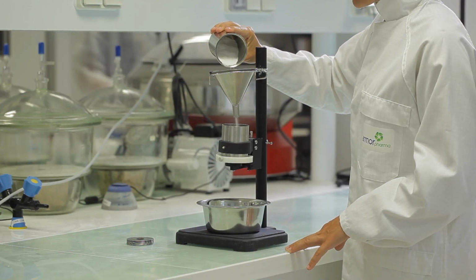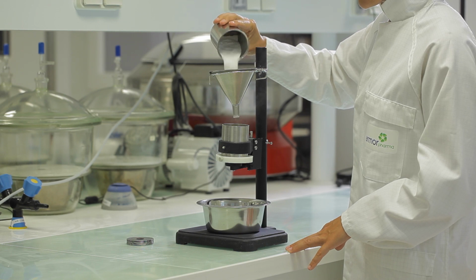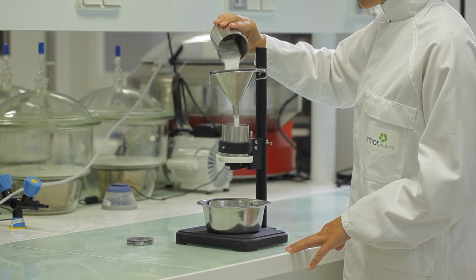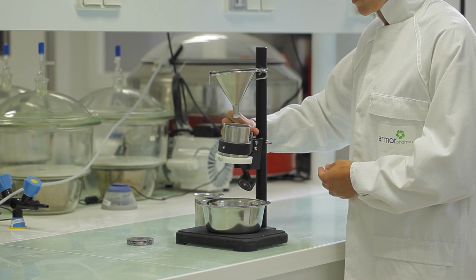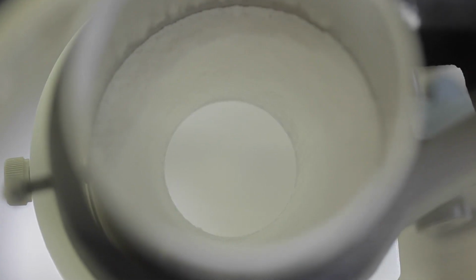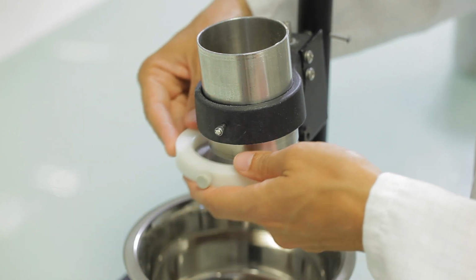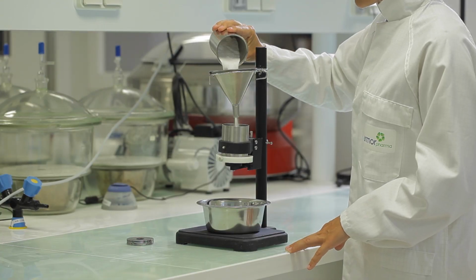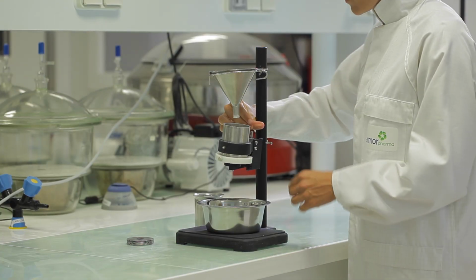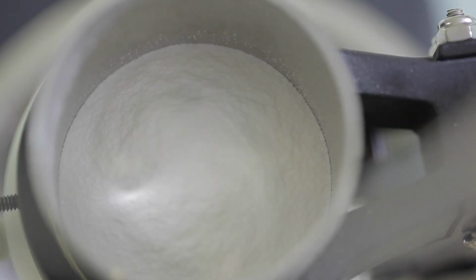Flowability can also be measured using a test instrument called Flodex. The determination of the flowability is based on the ability of the powder to fall through a circular opening in a disc after passing through a funnel. The flowability index is expressed in millimeters, corresponding to the smallest diameter of the opening that the powder will flow through. The smaller the dimension of the opening, the higher the flowability.